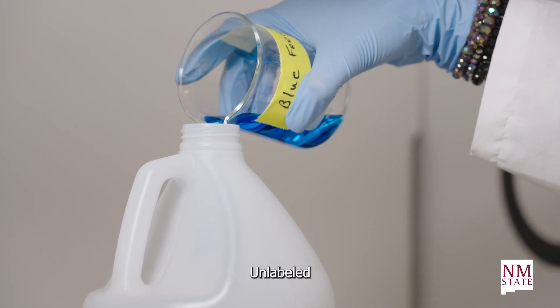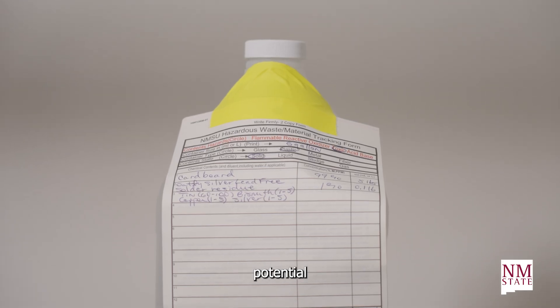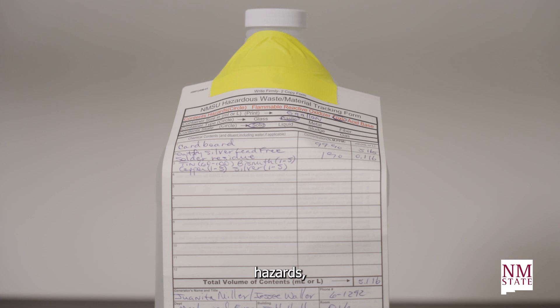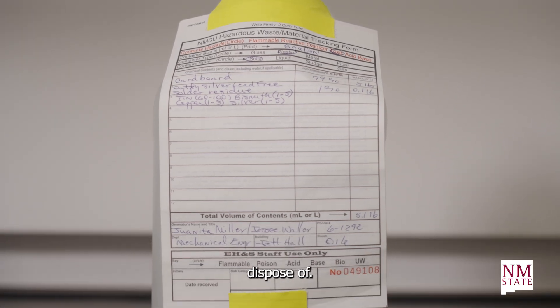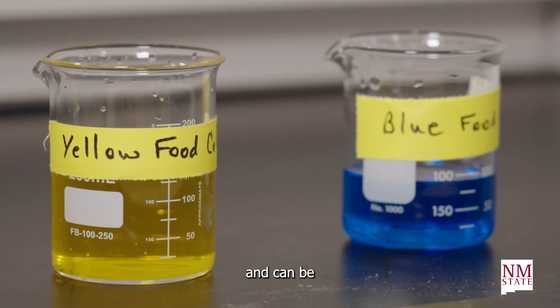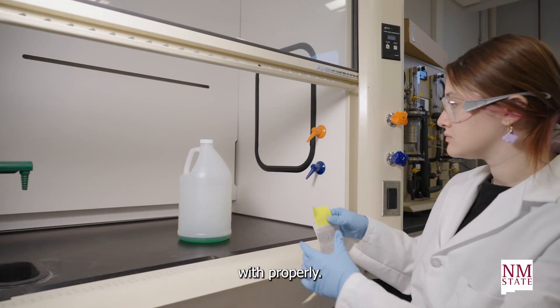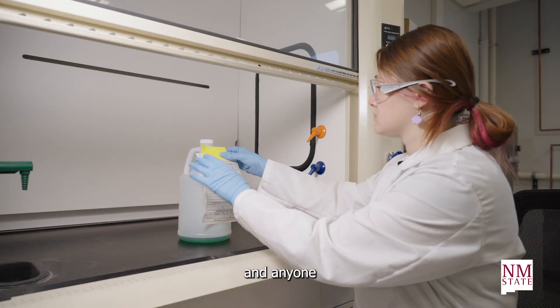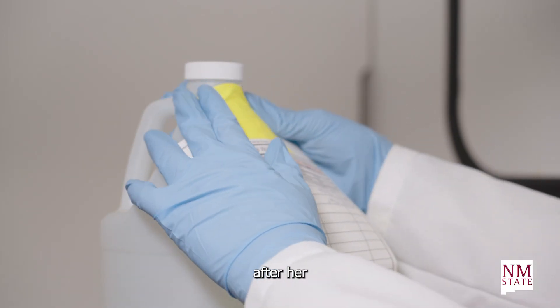Unlabeled or mislabeled chemicals not only present potential hazards, but are expensive to dispose of. Now they are labeled and can be worked with properly. Hannah and anyone who uses the lab after her will now know exactly what is in the containers.